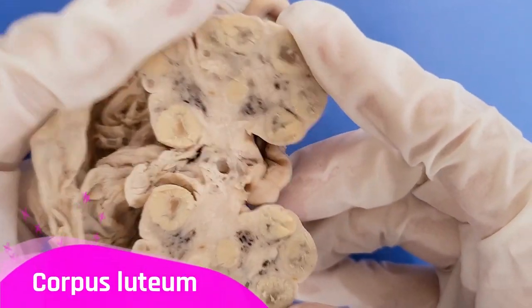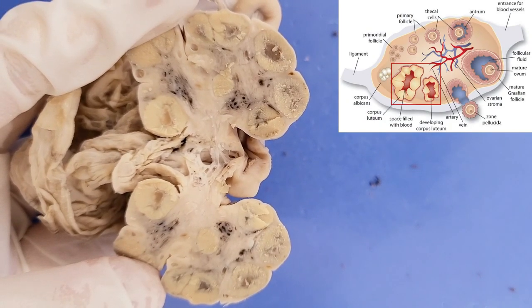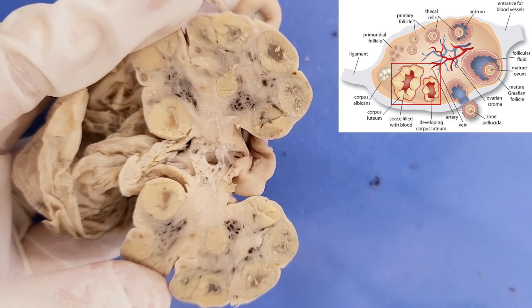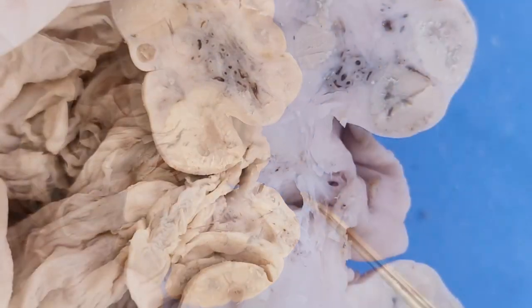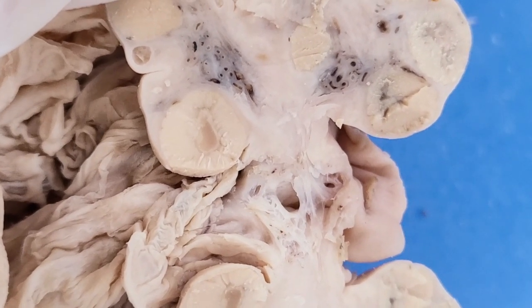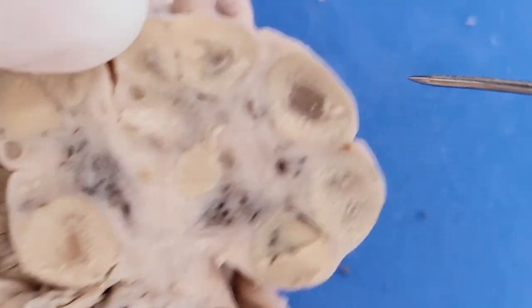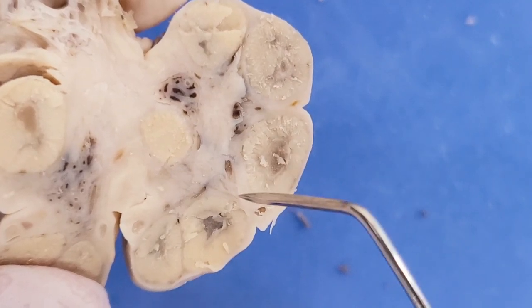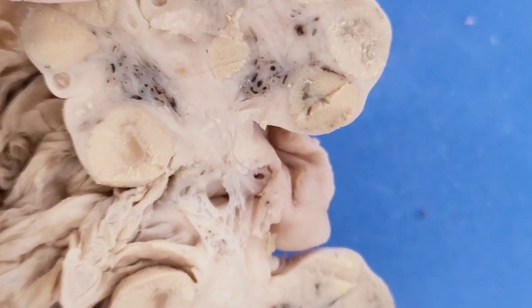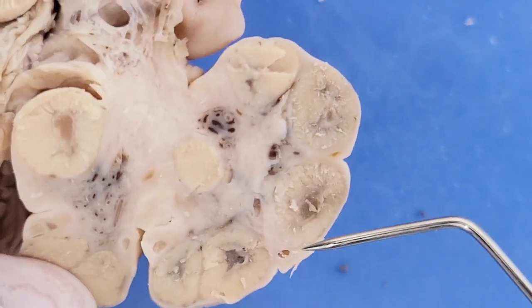After ovulation, the follicle — now without an egg — differentiates into a corpus luteum. The corpus luteum literally means 'yellow body,' and you can see these structures here do look yellow. In the middle of some corpus luteum you can see the fluid-filled cavity where the egg would have been before the follicle ruptured. This specimen was probably collected right after ovulation, which is why most of the follicles are corpus luteum instead of developing follicles.